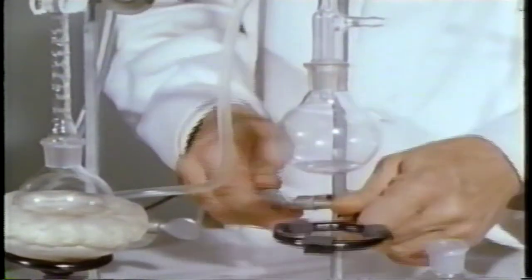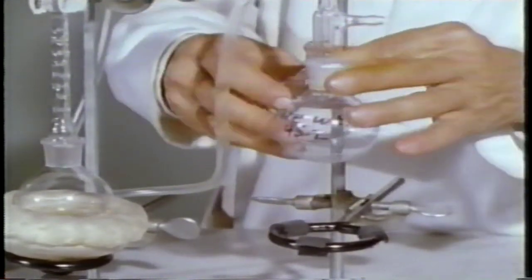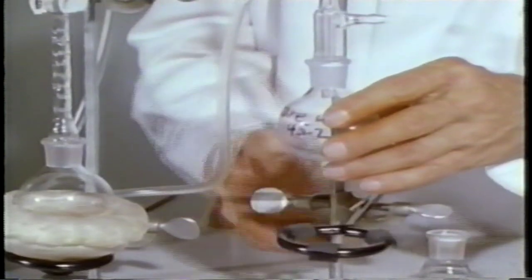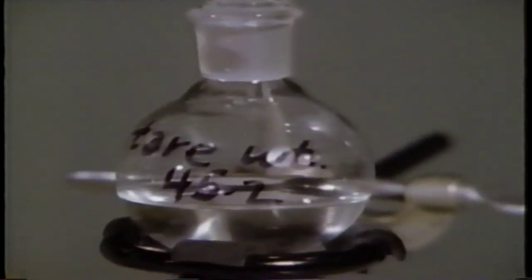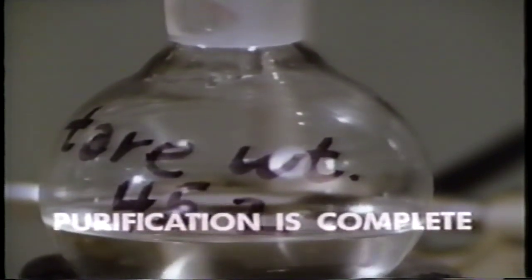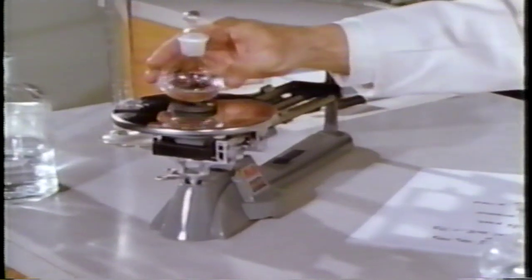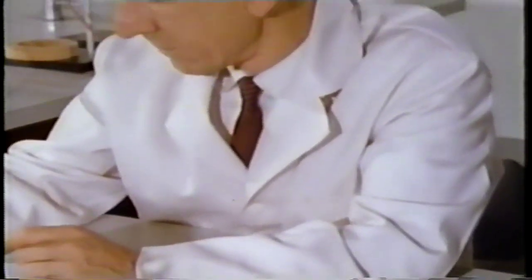At this point, change the receiver and attach a previously weighed flask. The temperature becomes constant just below 80 degrees. This indicates that the purified ketone is distilling and collecting in the receiver. The second stage, purification, is now complete. The flask is weighed to determine how much ketone has been obtained in the synthesis. The actual yield of our ketone is 30 grams.